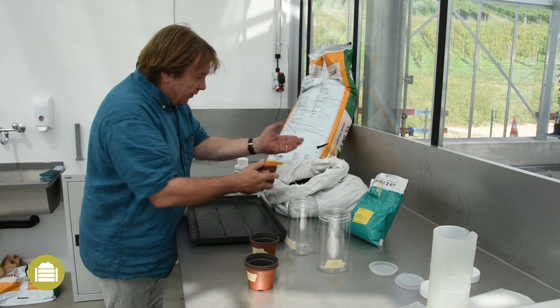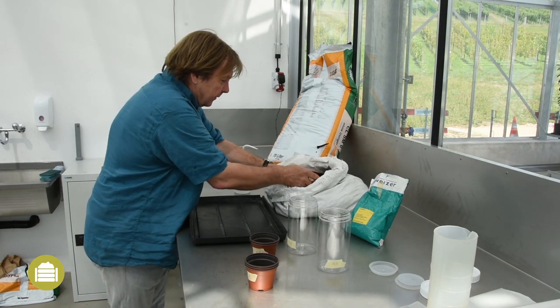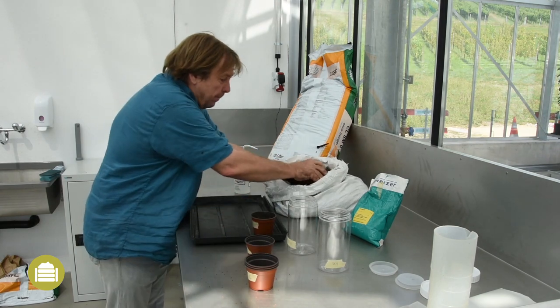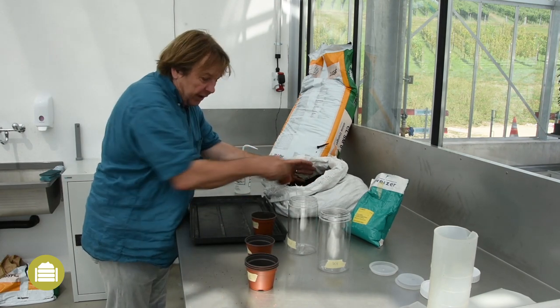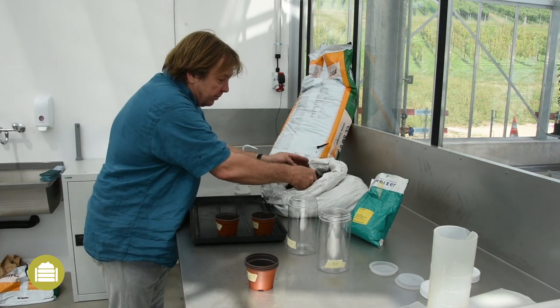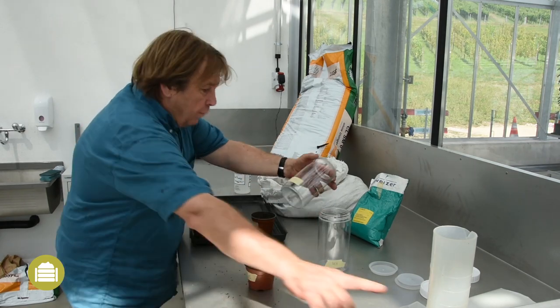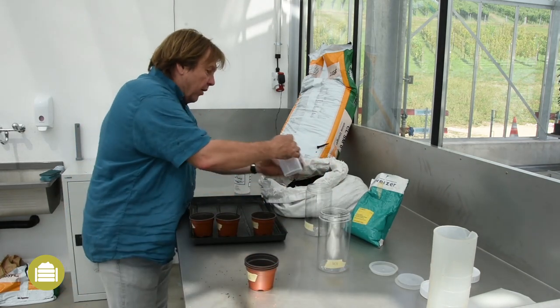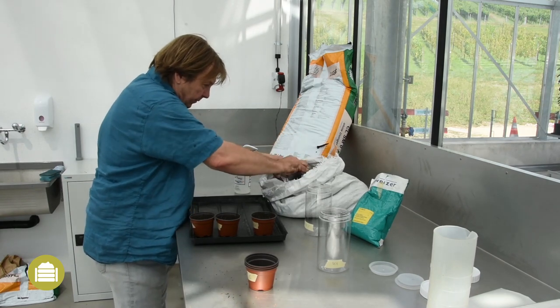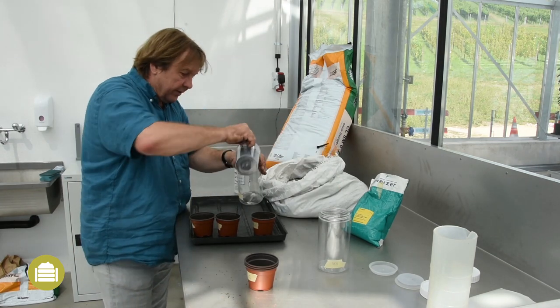The tested compost is always compared to a reference substrate. This reference is a peat substrate amended with mineral fertilizer to obtain stable responses over time. For the open test, three pots are filled with the compost and also the reference substrate, to ensure the quality and reliability of the test. The amount used for the closed test is 500 millilitres in a jar with one liter volume.